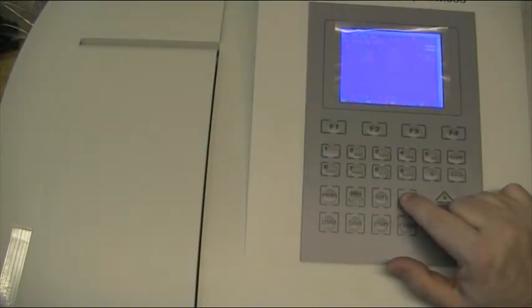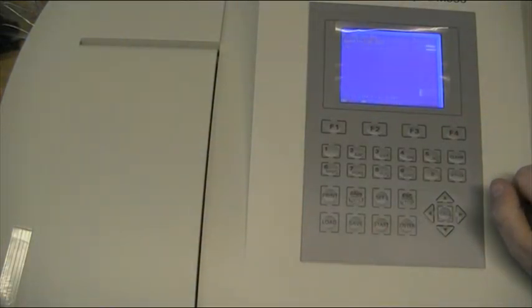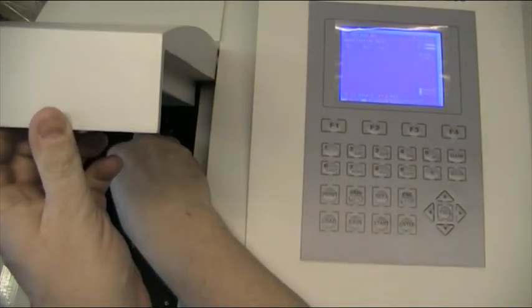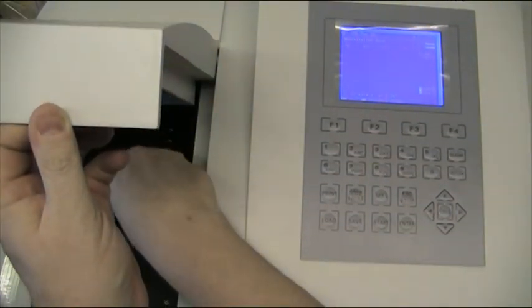If now I press escape from the calibration page, it'll take me back to the original page of the quantitative method, and this is where we can put some unknown samples in. So if I put a sample in the beam, and I press start, it will now read me an absorbance and the relative concentration of that unknown sample against the calibration curve, and then I can continue with more samples.